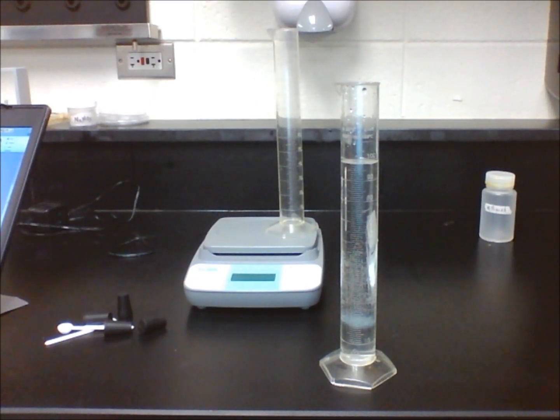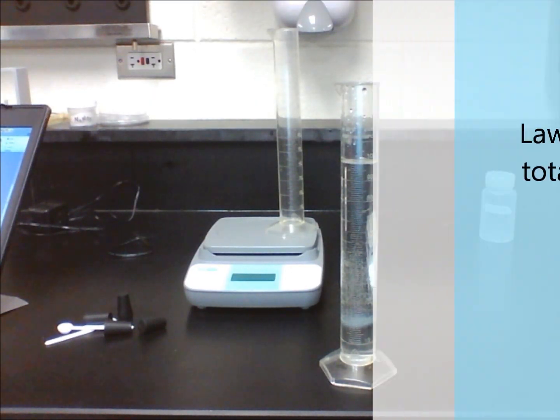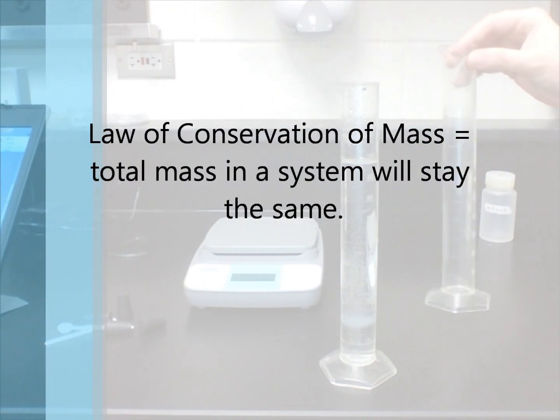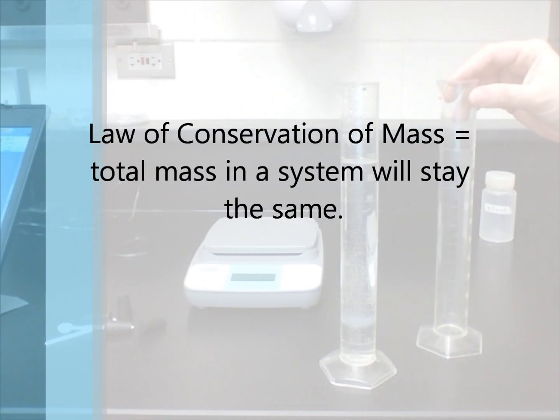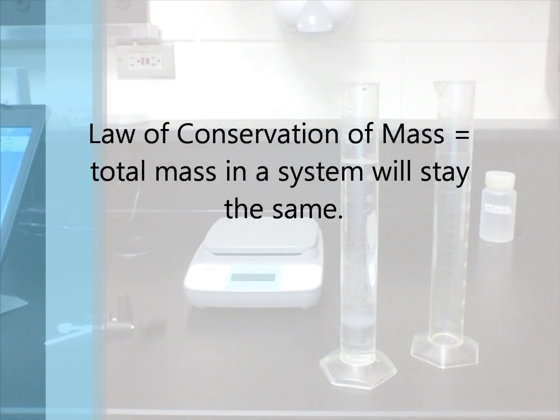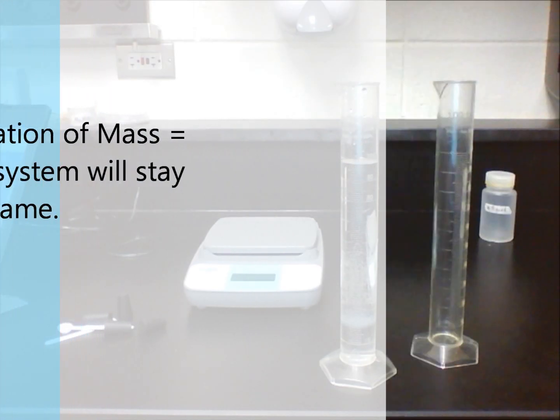It also shows that the mass stayed exactly the same. This helps to prove the law of conservation of mass. Even though the substances are mixed, we find that the number of molecules are exactly the same and the mass doesn't change.